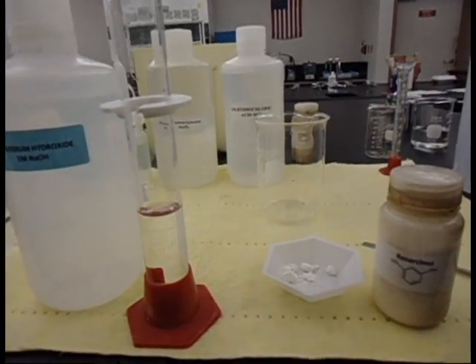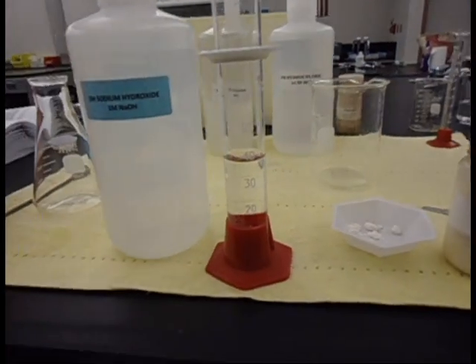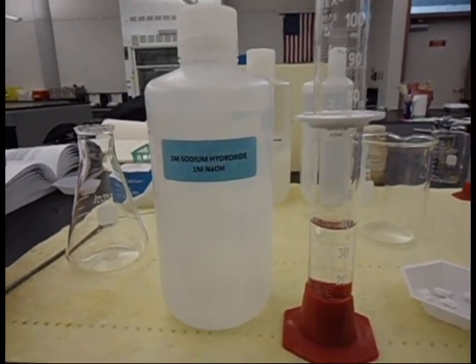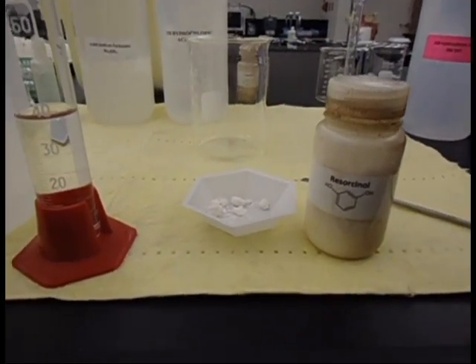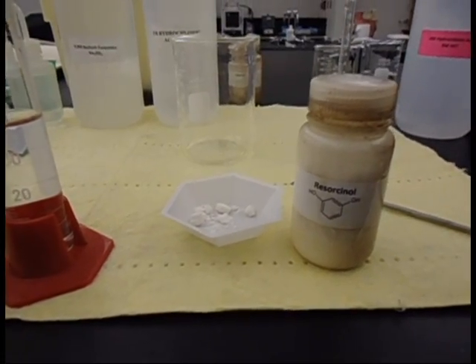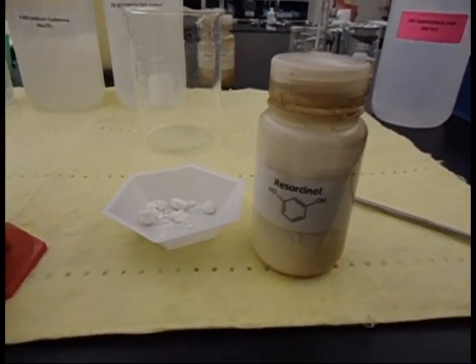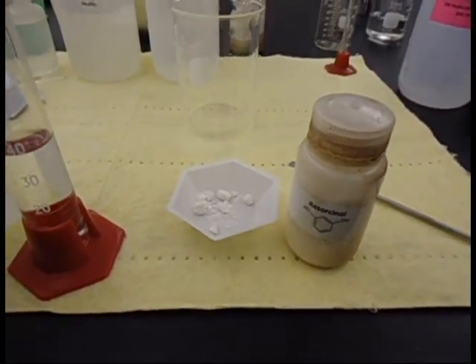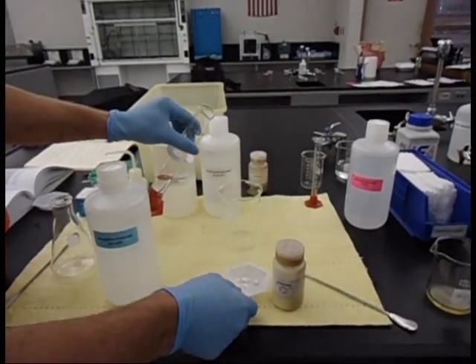We've got 40 milliliters of one molar sodium hydroxide, and we've got 0.94 grams of resorcinol weighed out in a weighboat. Now we're going to mix them in that beaker.